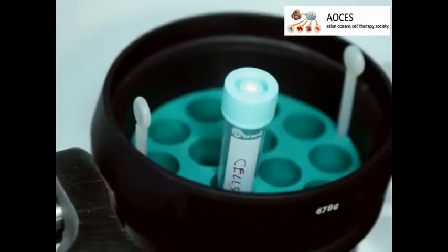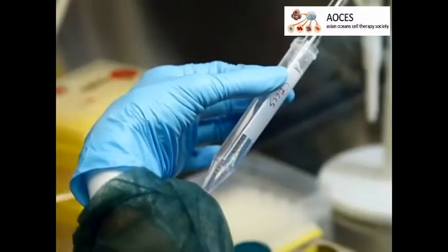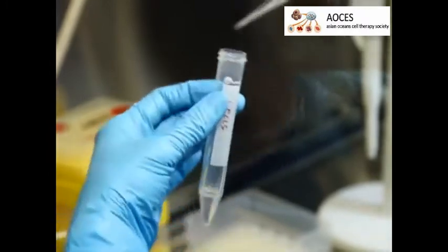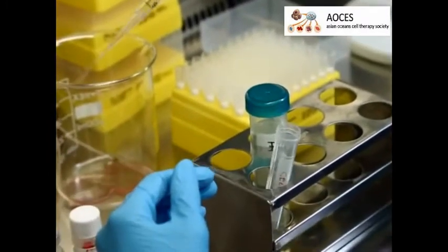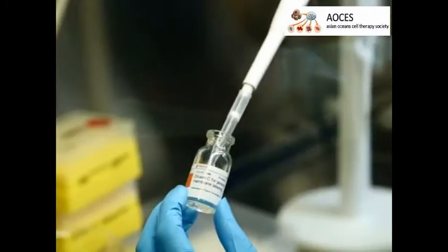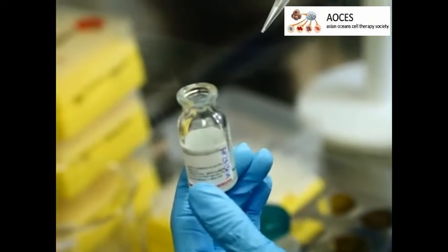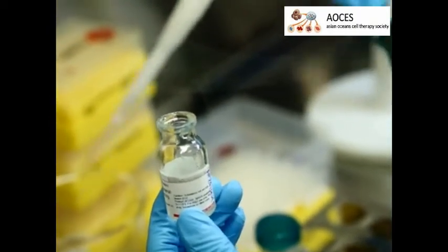Before the final spin, count the cells. Then, after spinning, aspirate the supernatant, leaving about 25 microliters of liquid to prevent aspirating any cells. Next, prepare a 2X suspension by adding 1 milliliter of diluent C to the cell pellet and use gentle pipetting to re-suspend it.